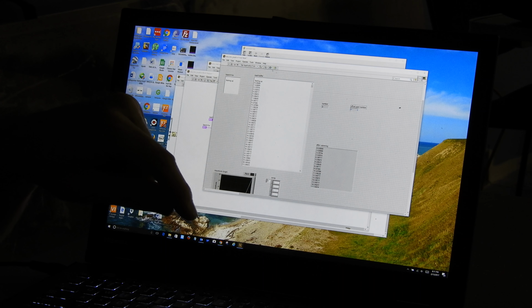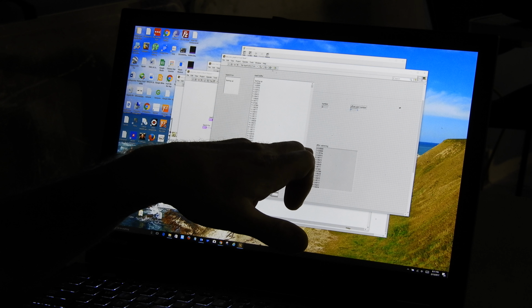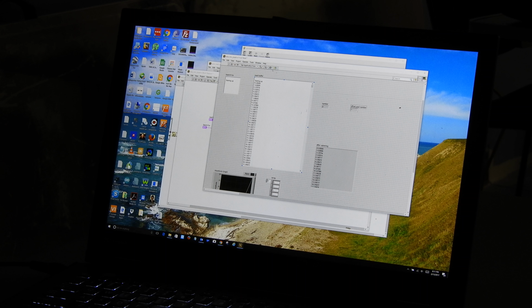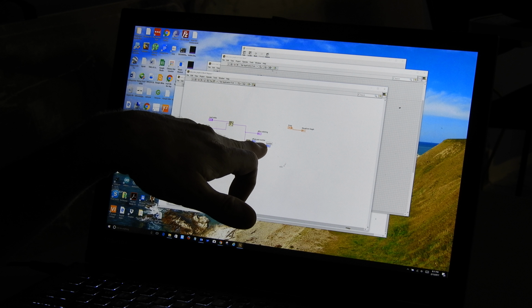It found the number 0. Okay, so if I were to take the rest of the string after that, it would take that 0 off. And I'm not going to do that because this video is just going to get too long. But bottom line is I took the first number off, and there it is, the 0.